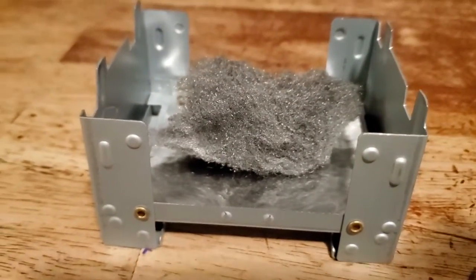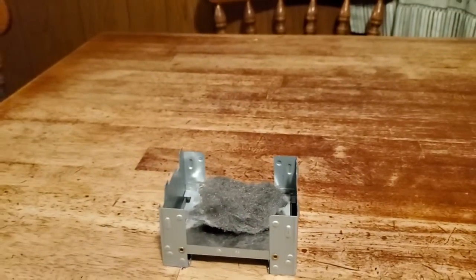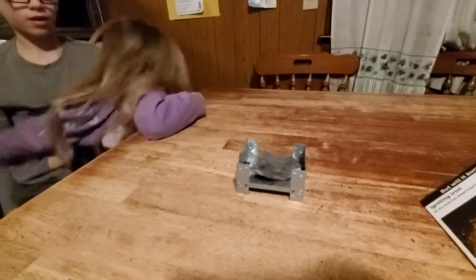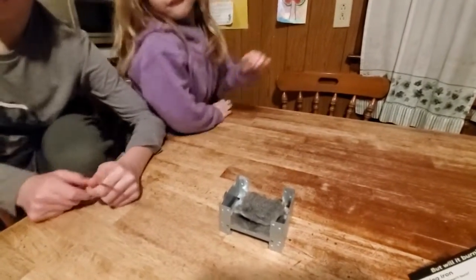There's the iron, and it's on this little hot plate thing here. And we're going to light it. Someone has to turn the light down because you can see it better.